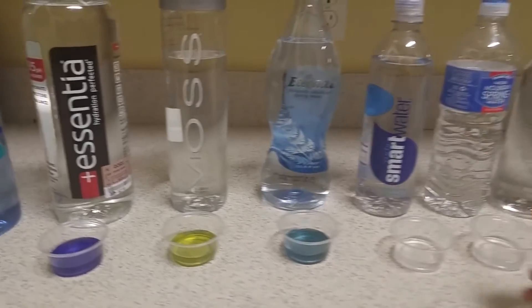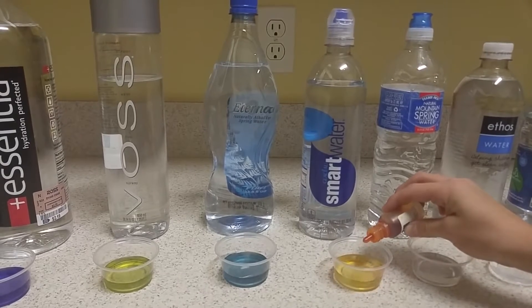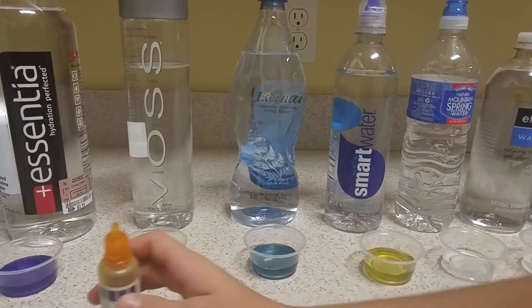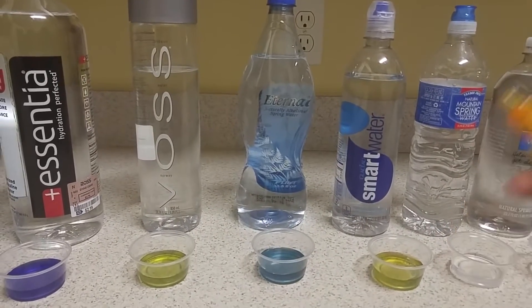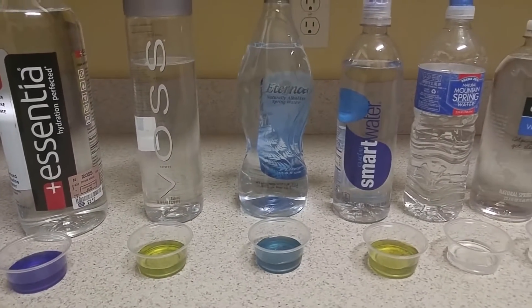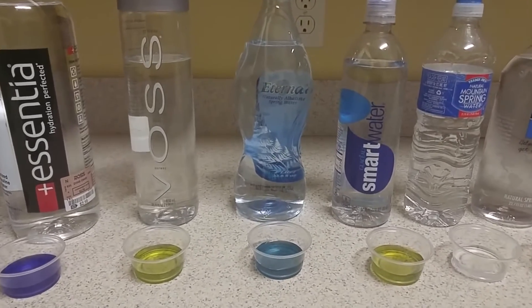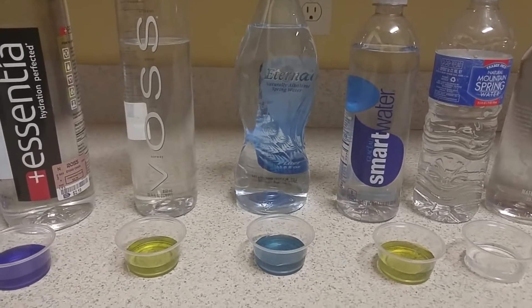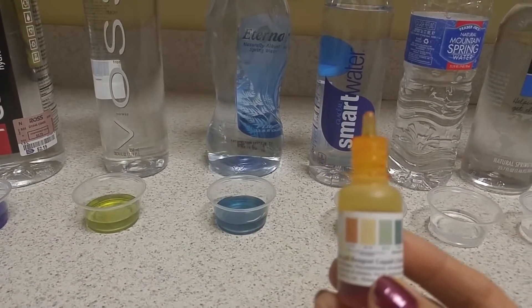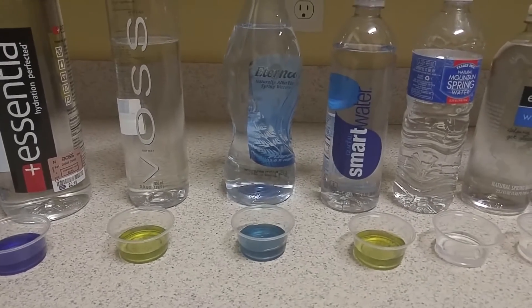Smart Water — let's see how good that one turns out. Whoa, that's not good at all. That's worse than Voss, or they're about the same. Smart Water is ranking very low on the pH scale — at an acidic level. Remember, it's not even neutral until it hits green, and right now that's yellow. It's at a 5.